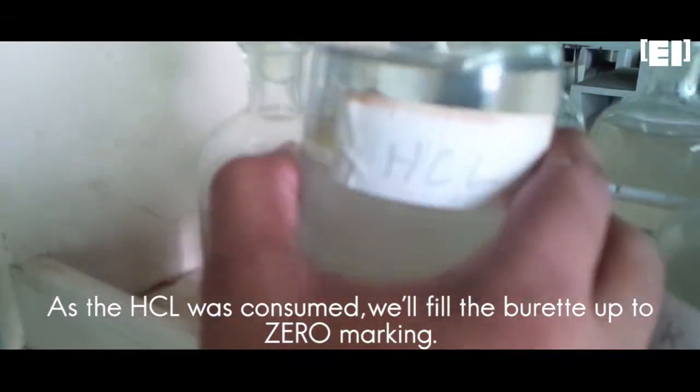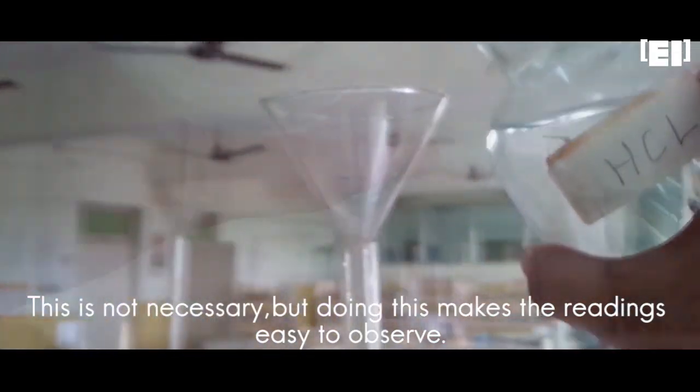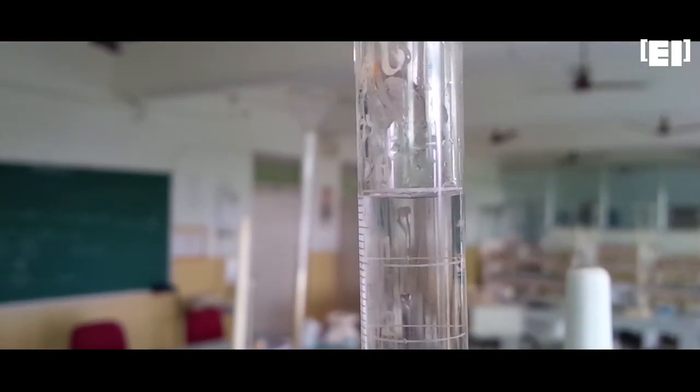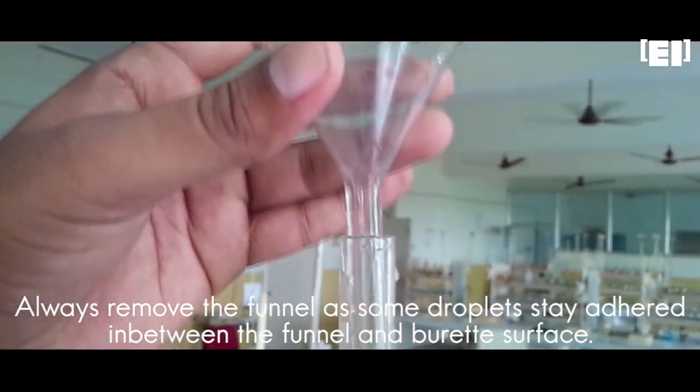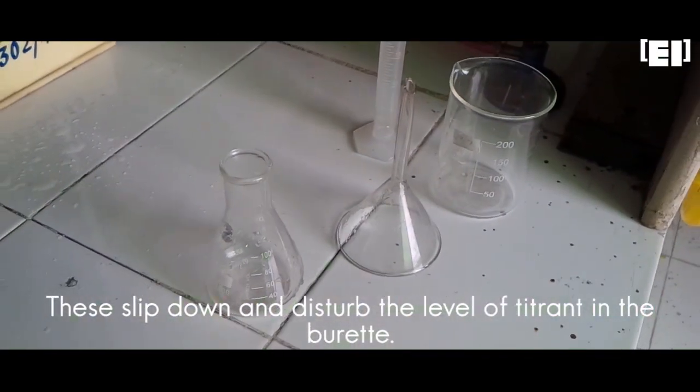As the HCl was consumed due to the titration, we'll fill the burette up to 0 marking. Well, this is not necessary, but doing this makes the readings easy to observe. After filling the burette, always remove the funnel as some droplets stay adhered in between the funnel and burette surface, and these slip down and disturb the level of the titrant in the burette.